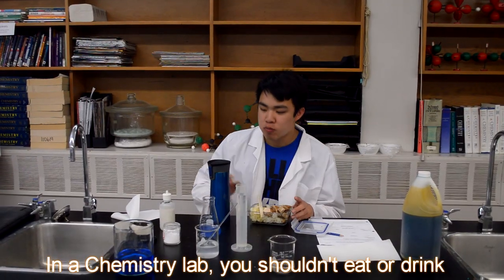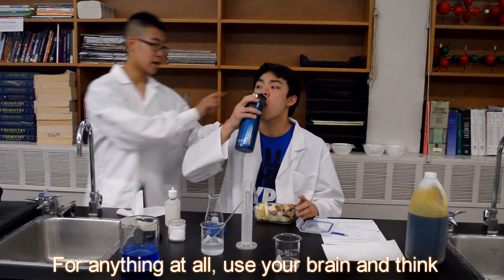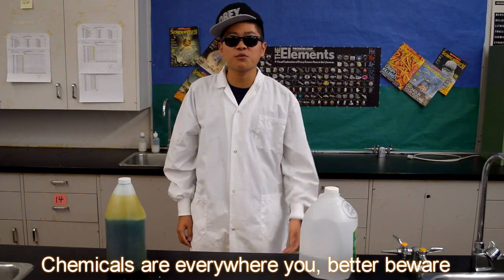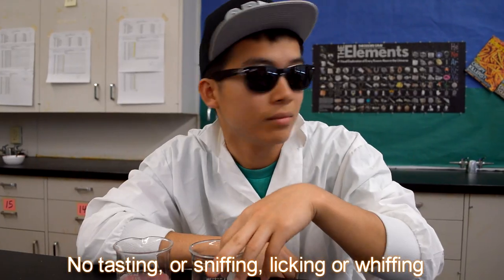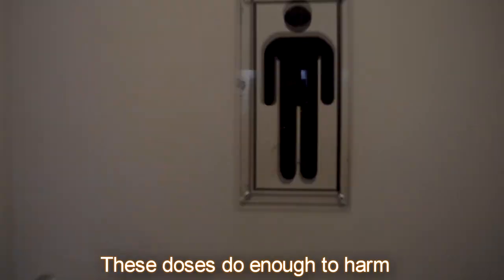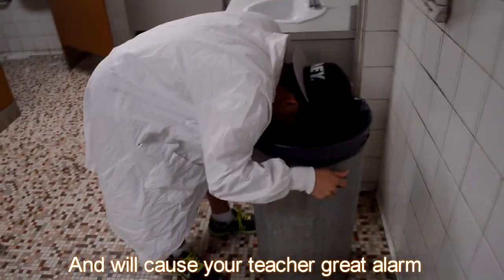In a chemistry lab, you shouldn't eat or drink. For anything at all, use your brain and think. Chemicals here, chemicals there, chemicals are everywhere, you better beware. No tasting, licking, sniffing, or whiffing. Yo, this ain't home ec. These doses do enough to harm and will cause your teacher great alarm.